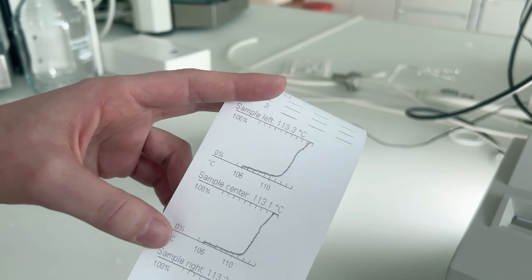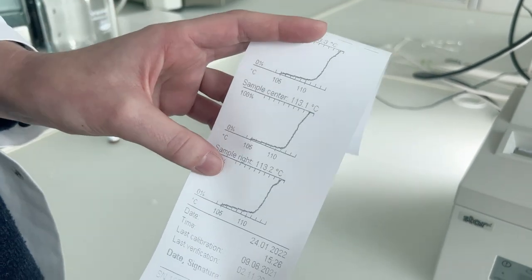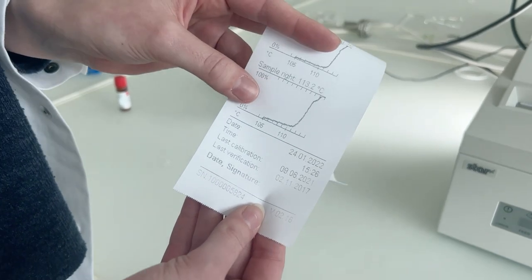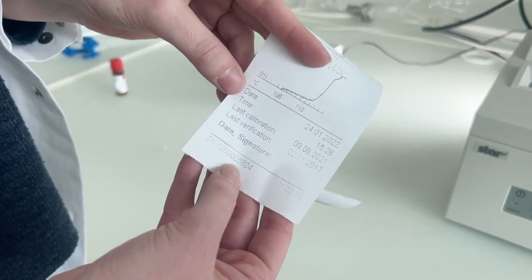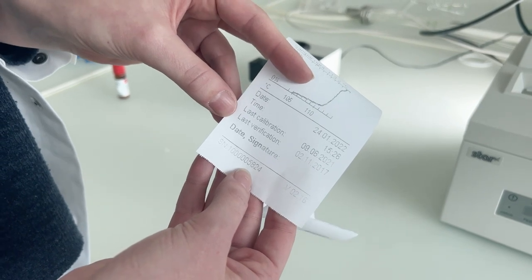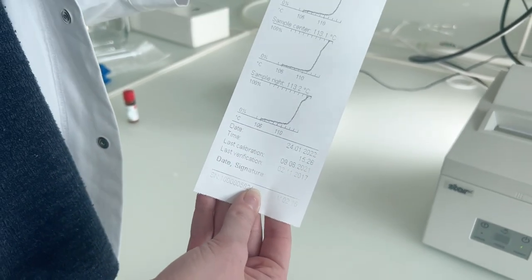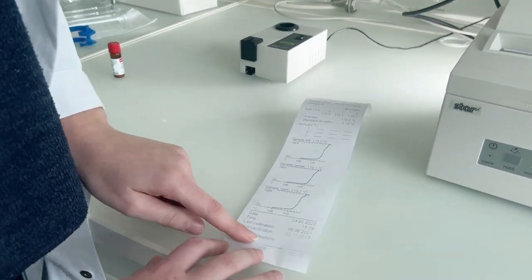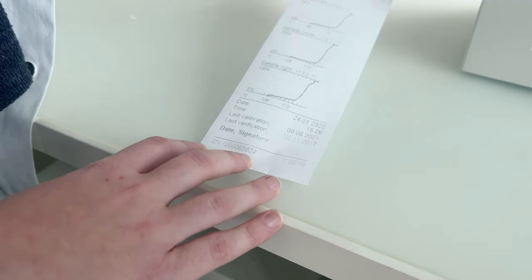The printout also shows all my melting point curves — as you can see they are very similar, which is a good sign. Below that I have the date, time, the last calibration date, and the last verification date. If I need this for an official report, I just add the date and my signature and that's everything I need.